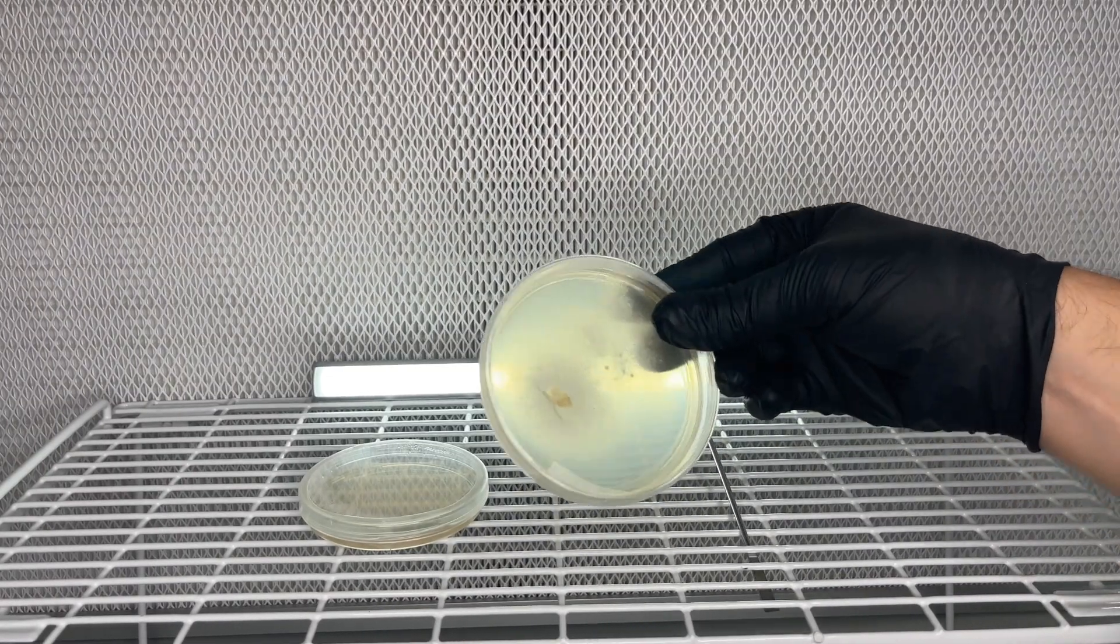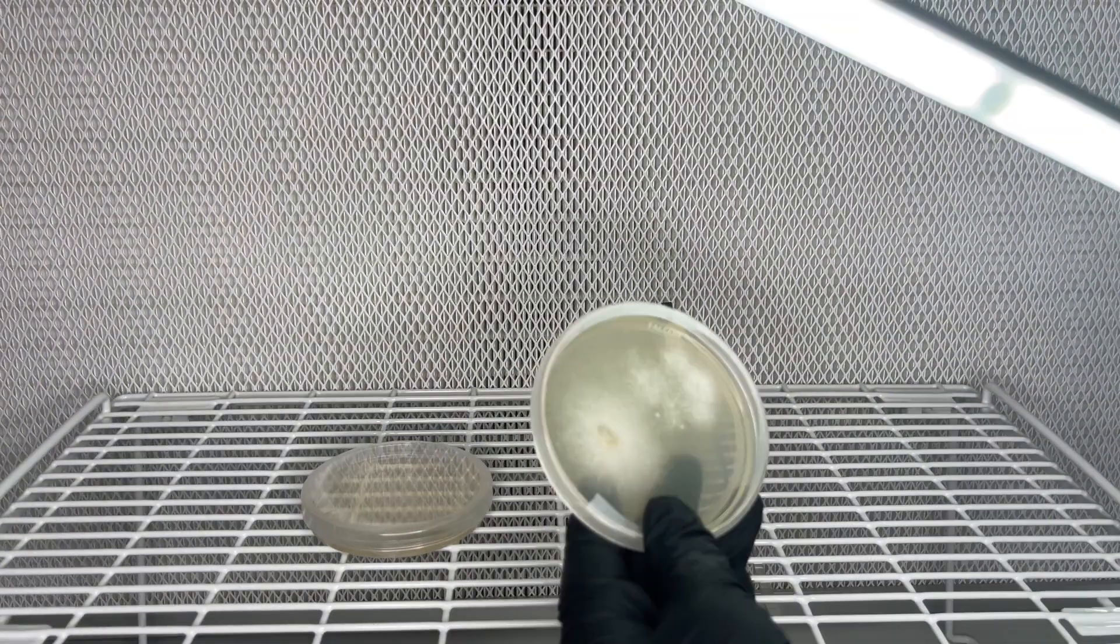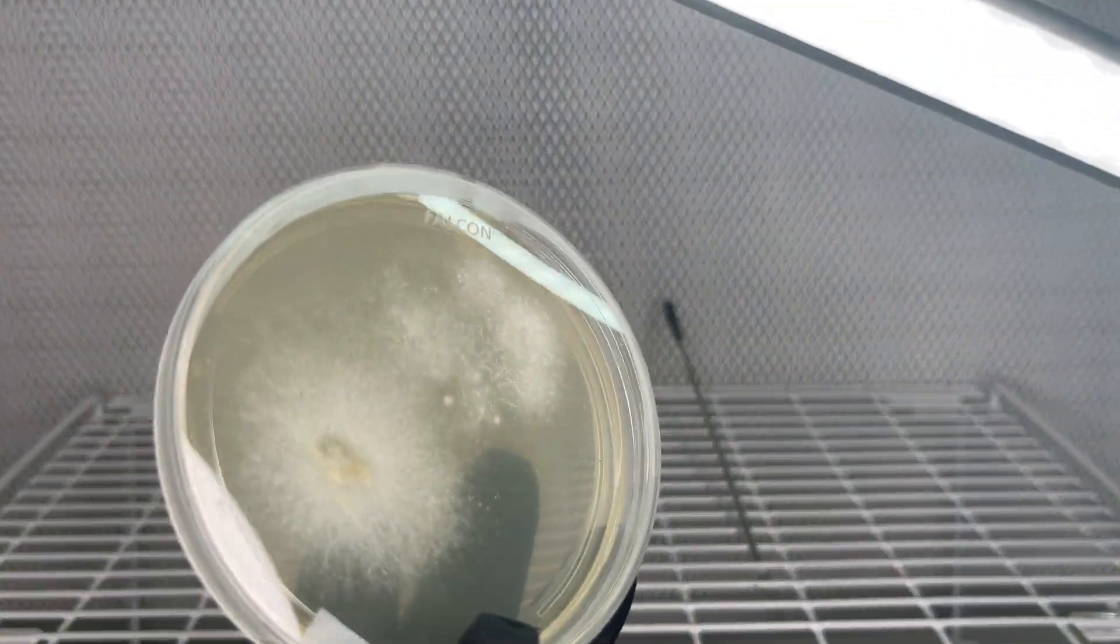And here I have successfully isolated the mycelium onto the agar plate where I wouldn't have been able to do this before with the original agar plate.